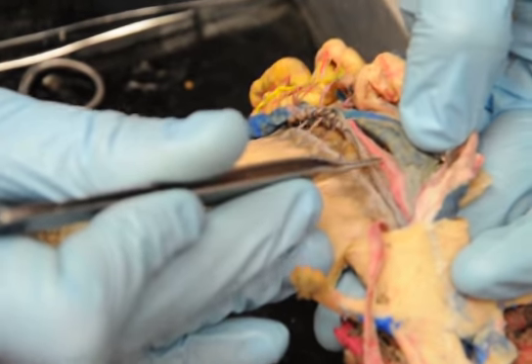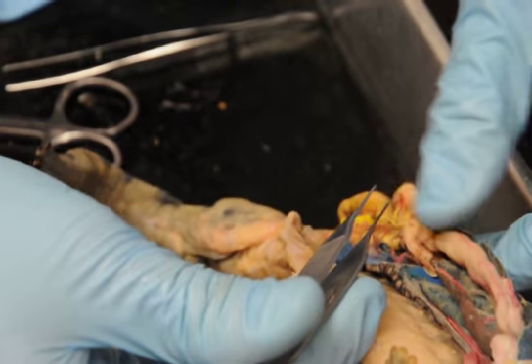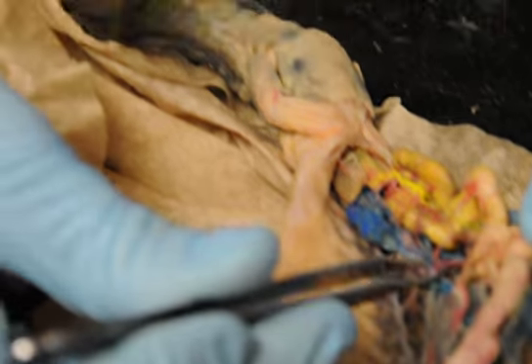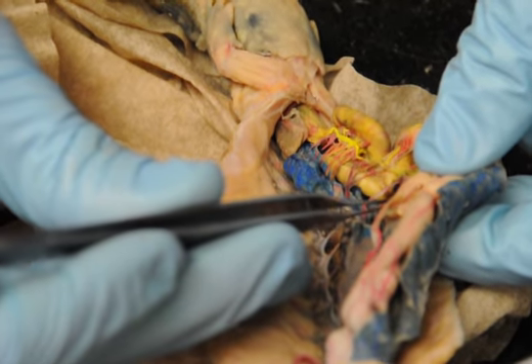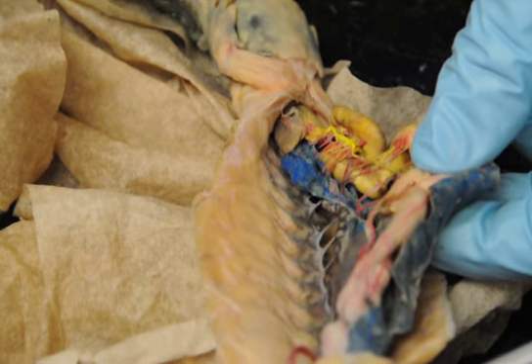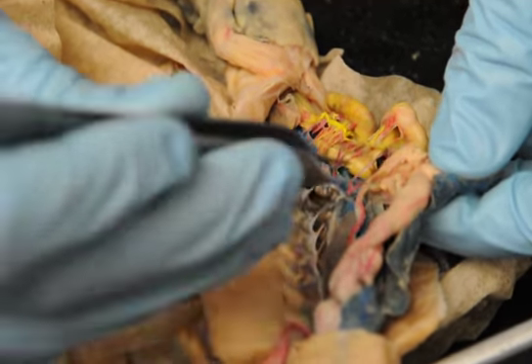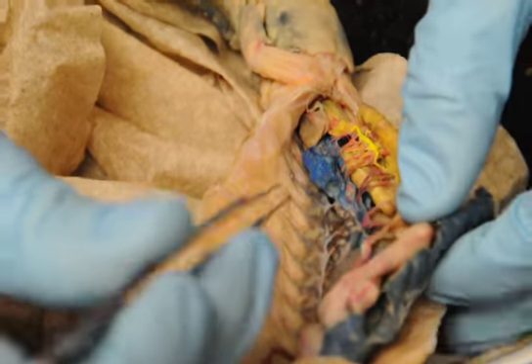Alright, then you follow the dorsal aorta down, and your next major branch off the aorta is the celiaco-mesenteric here. So it's pretty similar to your celiac trunk in your cat. So in the cat you have the HGS. What does HGS stand for? Hepatic, gastric, splenic. So you have a hepatic and a splenic, you just don't have a gastric on this one. You have a pancreatico-duodenal instead.